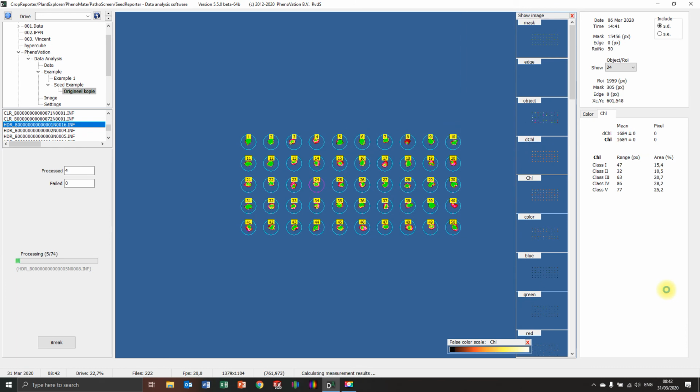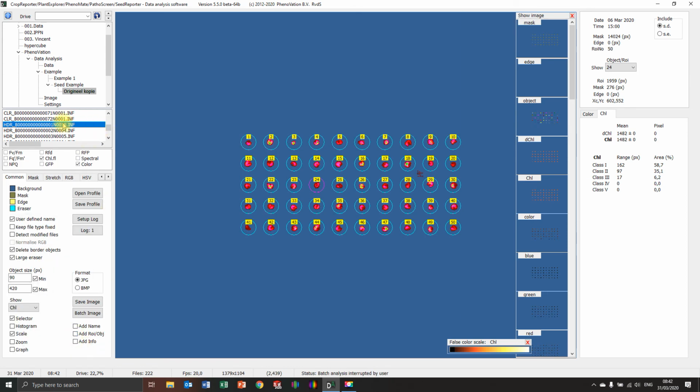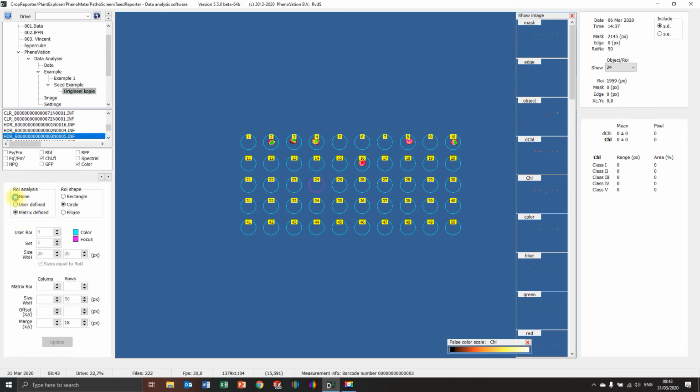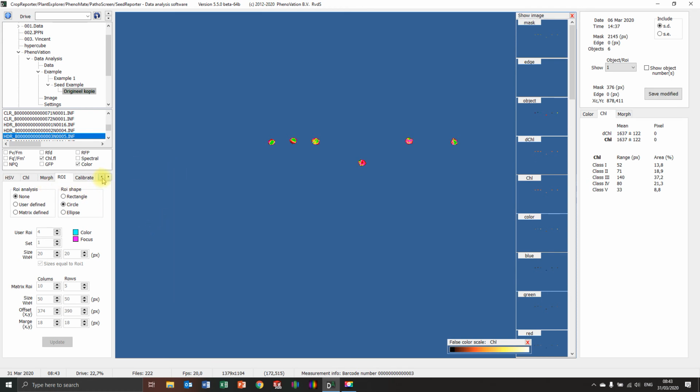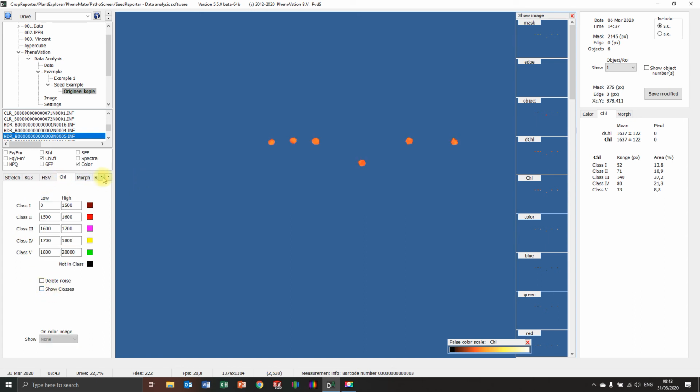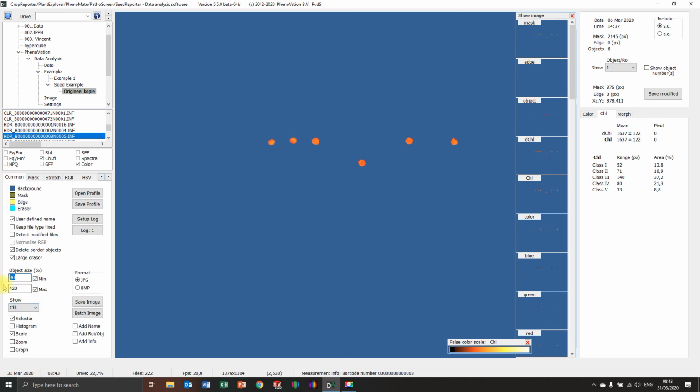There's the first problem. You saw it, seeds were disappearing. Again, seeds are disappearing. There's no seeds at all. So, break. This is not going to work because some settings, like in this one, are not useful for this image. Why? That's my question. So we're going to take a look at, let me see, first put off the mask. There it is. Probably one of these is too tight.